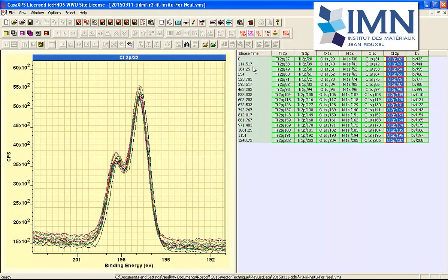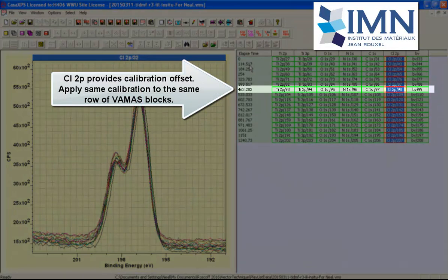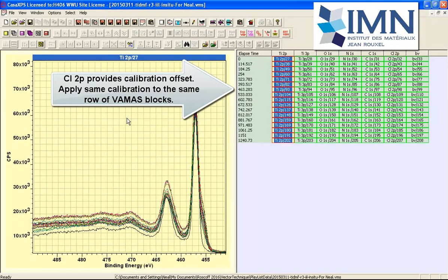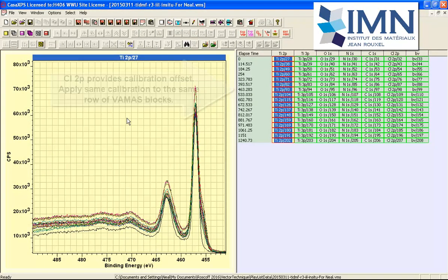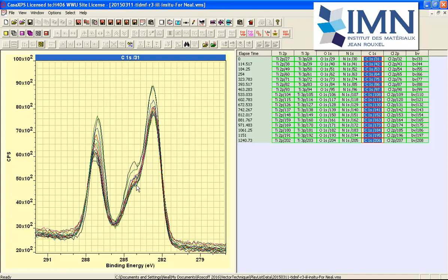And the reason the charge compensation is different between these measurements is that the sample surface is evolving chemically as a consequence of exposing the surface to UV radiation. Charge correction is often performed using the carbon 1S. However, we have quite an involved structure here, and if we were to work out the peak position based on a peak model, we would have to have a lot of confidence in the way we've constructed the peak model to ensure that we've got a calibration peak in the right place.